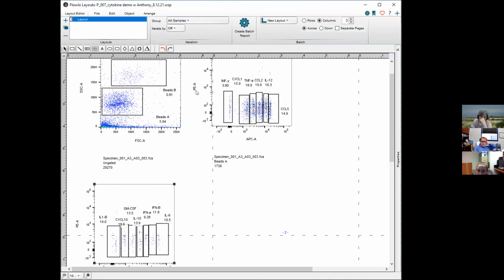So all the beads are coded in PE, and then APC is used to separate the different cytokines, because they all have various expression of APC. From what I understand, that's how it works. Because we use streptavidin PE at the last step. I add that streptavidin PE for 30 minutes, and then I wash and resuspend and run the samples. Yeah, there's a problem here, because the last step, the antibody cocktail you put in is PE, obviously because streptavidin PE is the last step. Yeah.